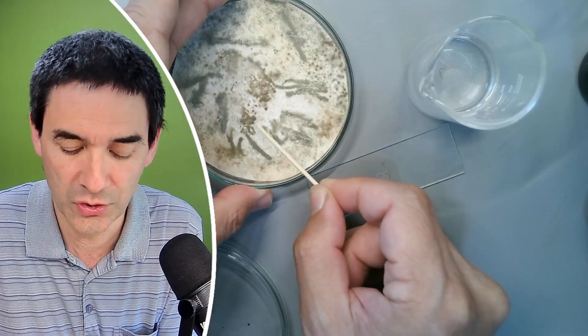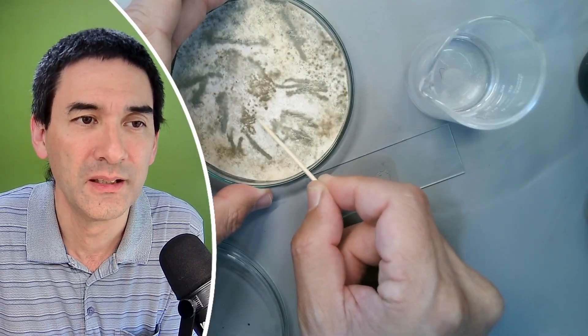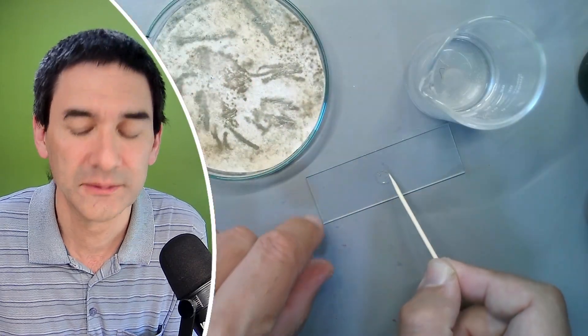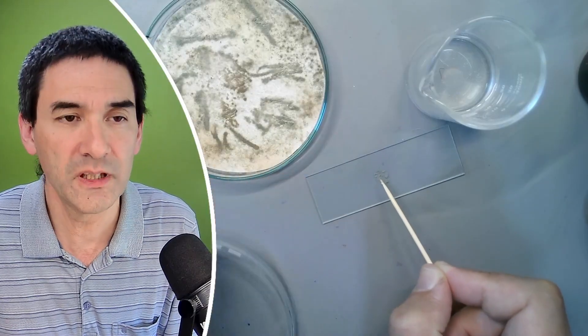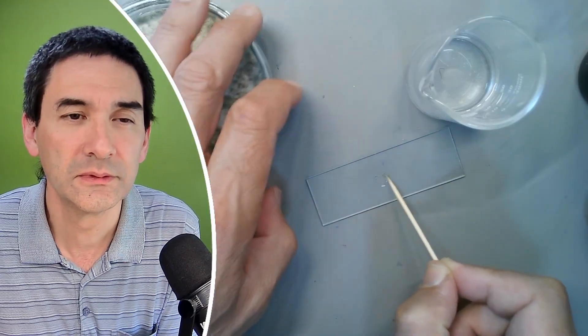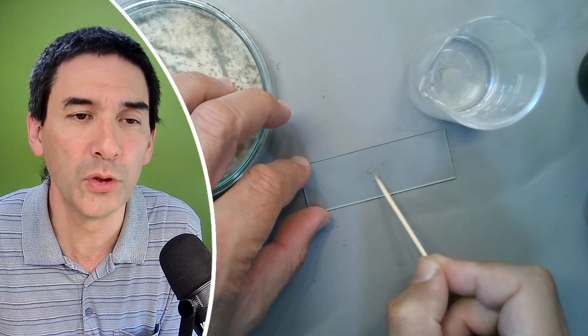And maybe we try it again. Of course you don't want to inhale them. I mean, that goes without saying. So I think that should be enough. Let's put the lid on top. You want to dispose of the toothpick of course.